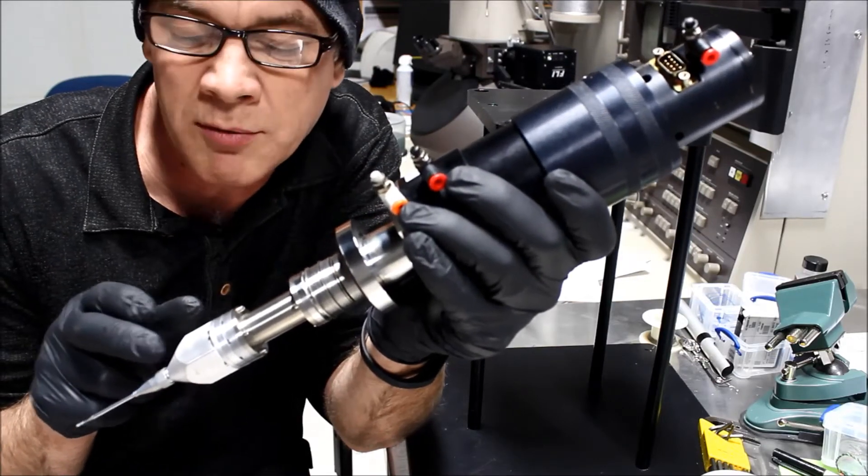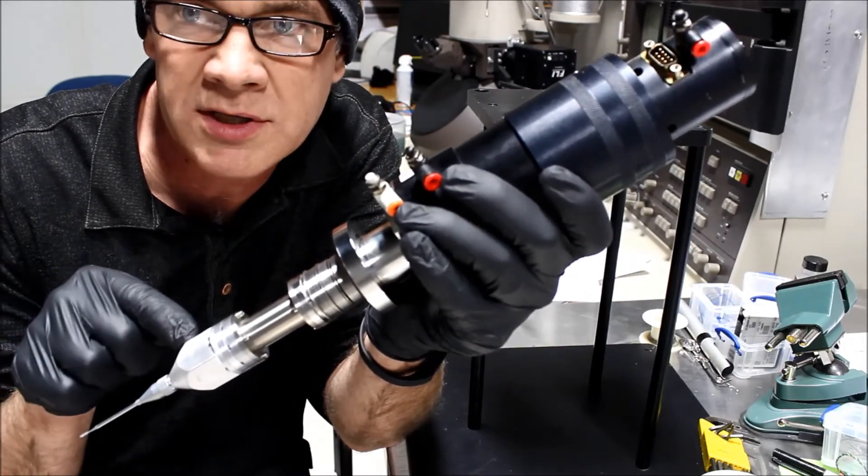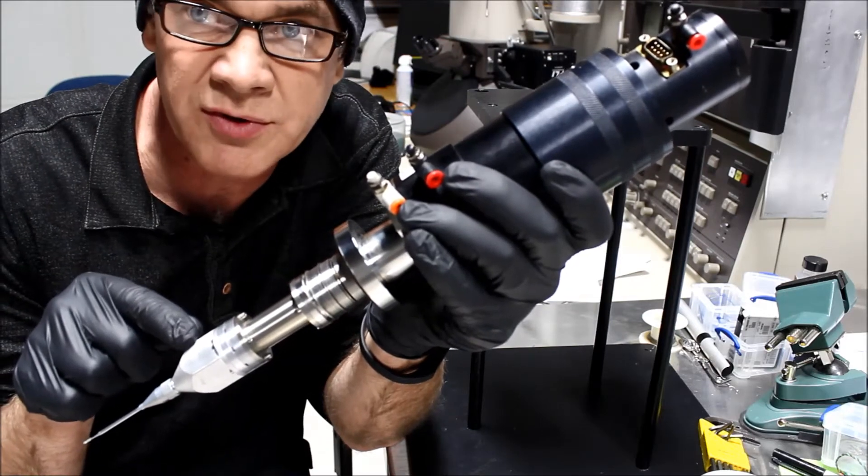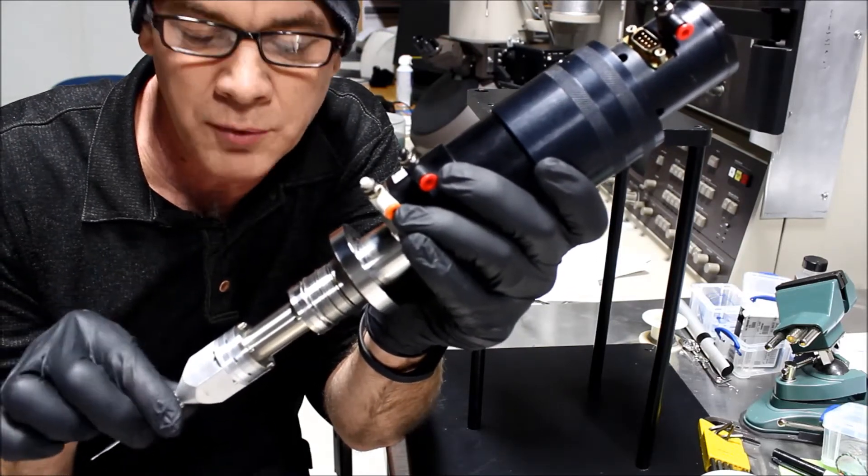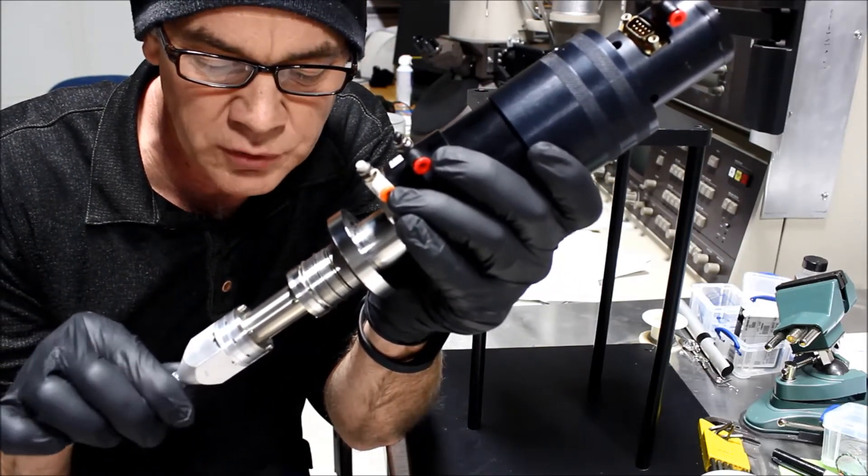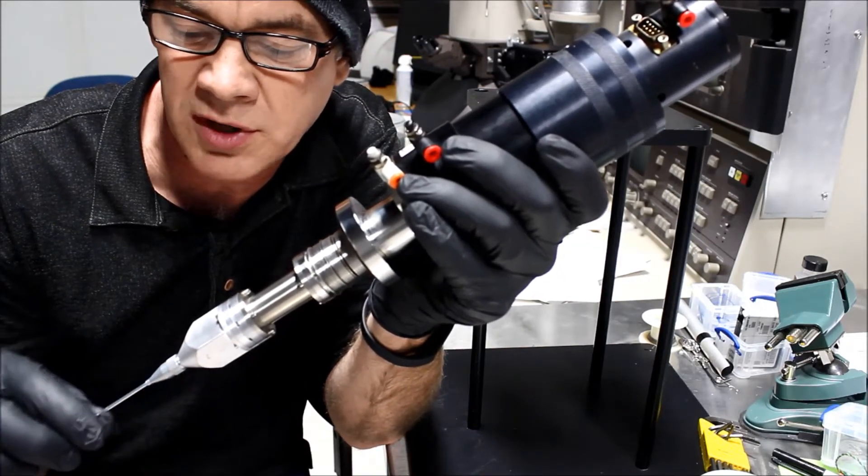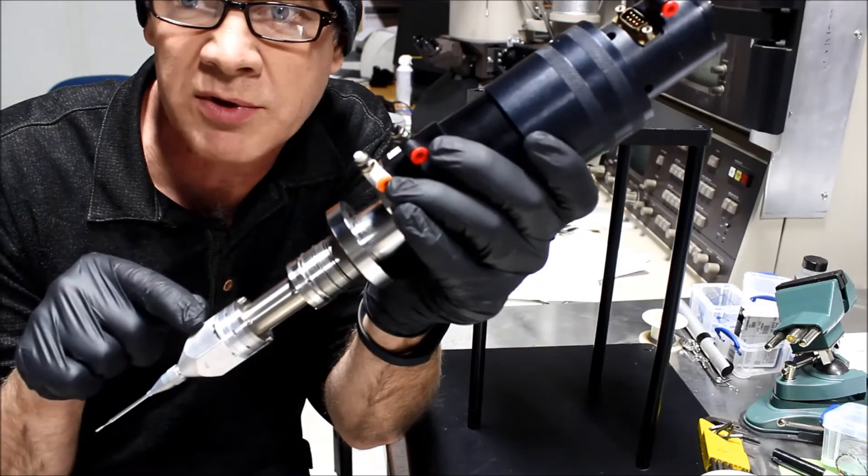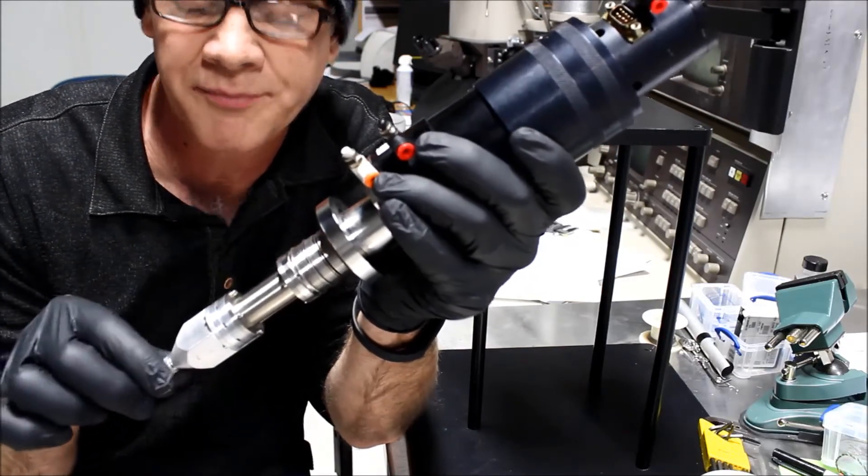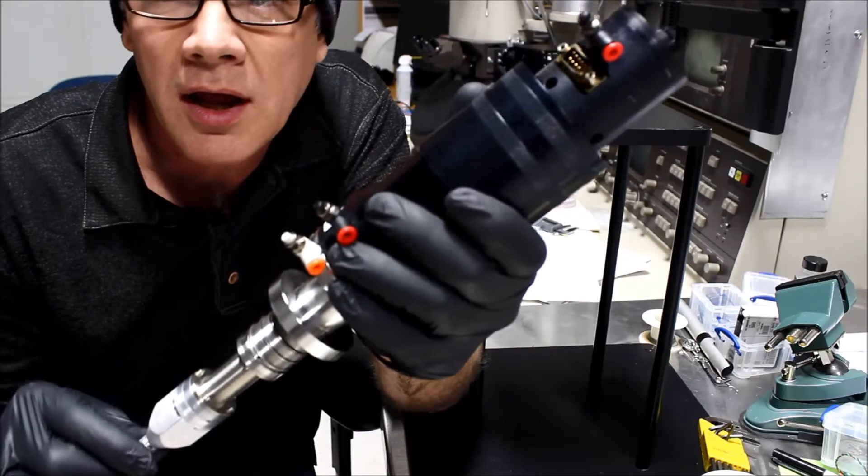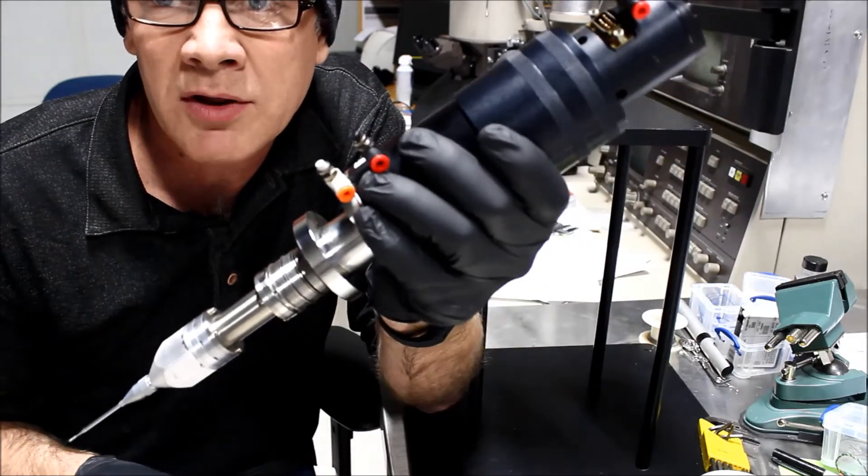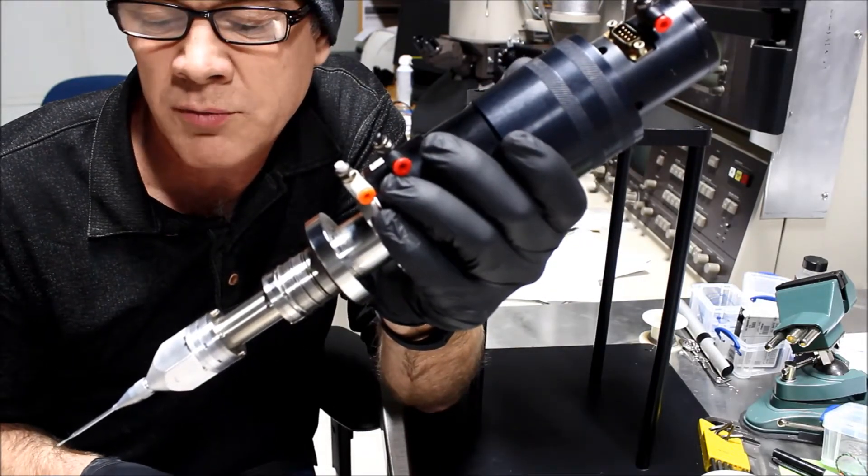Bear in mind that we're just doing this in a lab environment right now, and if I really had chemical in this, I'd be doing this demonstration in a fume hood. When you do this yourself, this should be done in a fume hood to avoid any possible exposure to chemical vapor. Again, this one has been decontaminated and there's no risk of chemical exposure here.